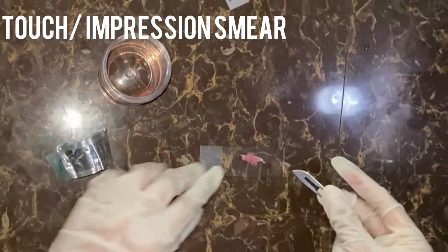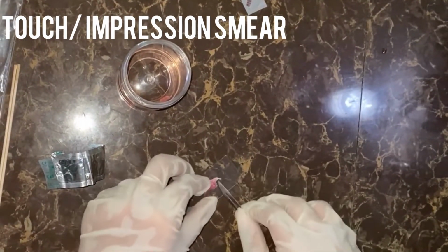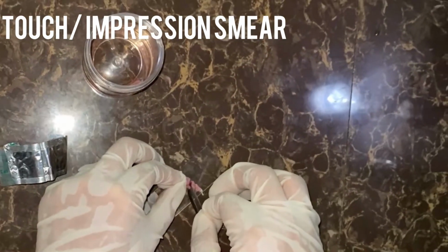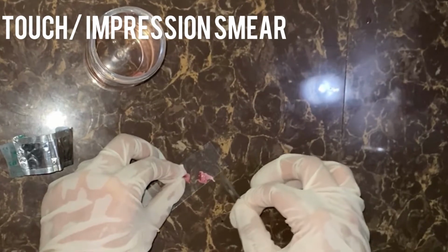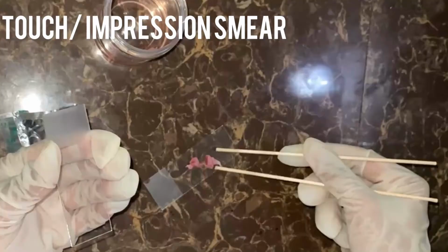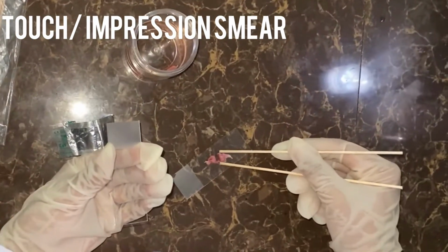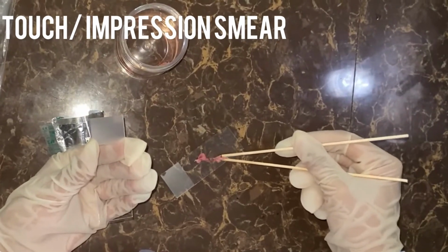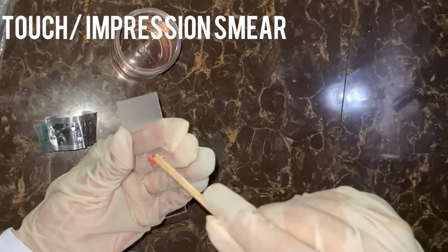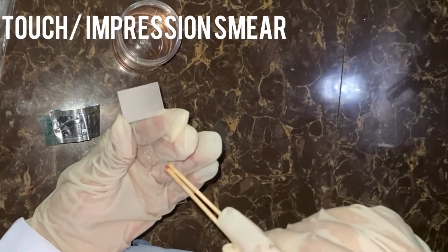Touch or impression smear. Imprint method. First, cut the block in half, exposing a fresher surface. Second, allow the freshly cut surface to come in contact with the surface of a clean glass slide. Third, apply gentle pressure, allowing the cells to be transferred directly to the slide.